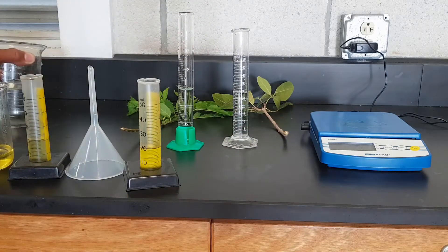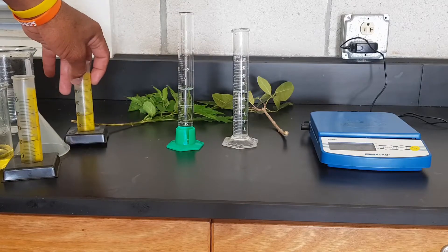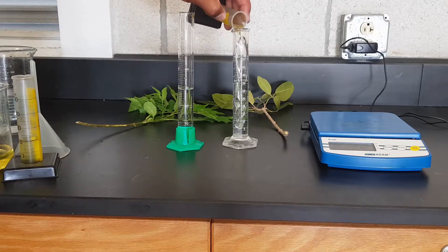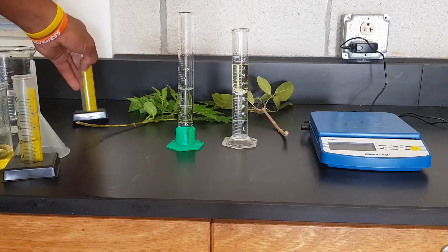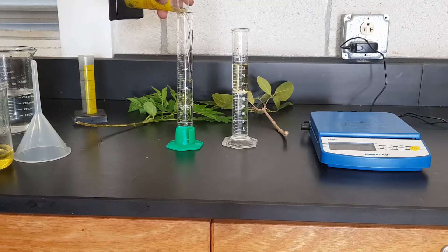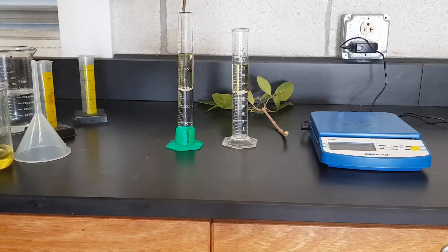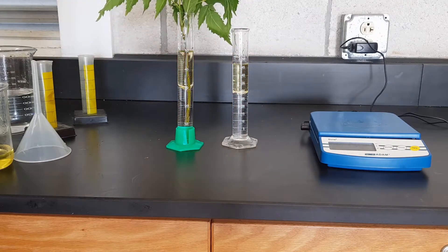Here I put 30 ml of water in each measuring cylinder. The next step is to pour the oil, and again I'm using the same volume of oil. I want to make sure the water is covered properly, and then I'm going to add a plant in each of the measuring cylinders.